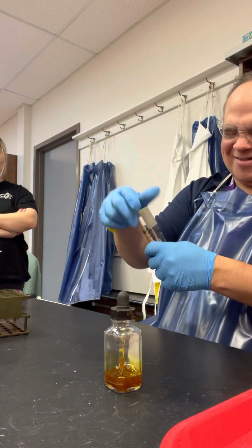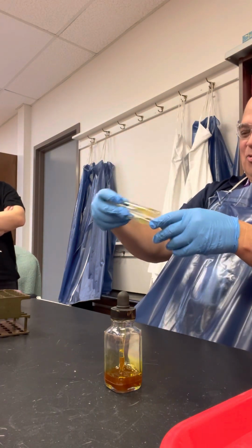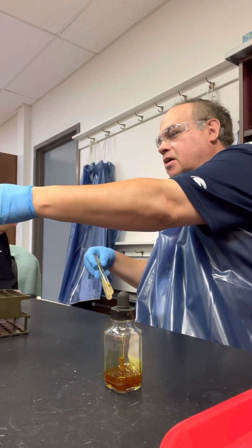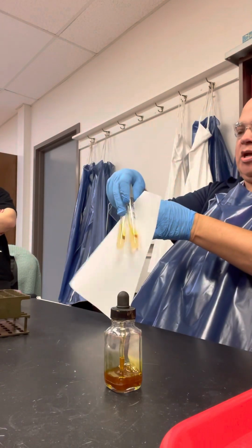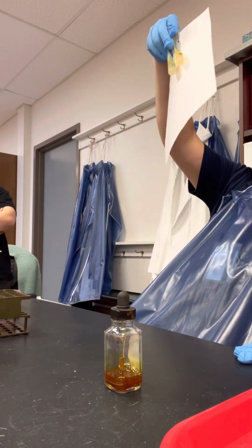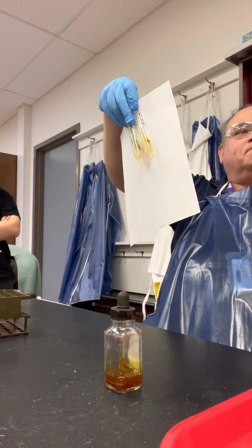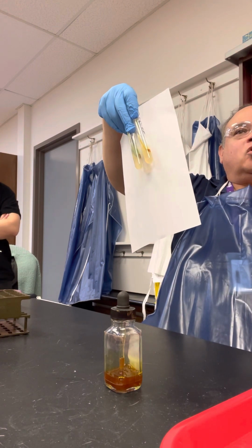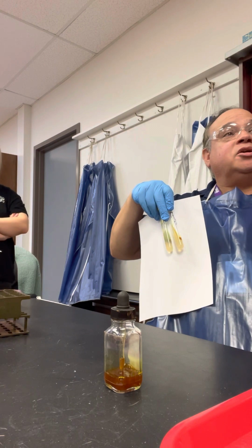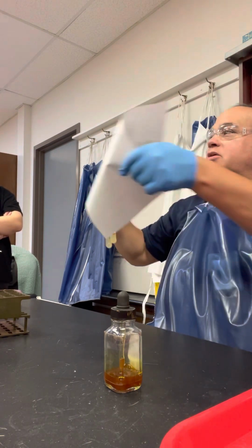When you mix these up, can you appreciate that one of them is green and one of them is not green? The one that is green is positive. The one that is not green is negative. Okay? Good? And it's positive for the enzyme, the utilization of phenylalanine. Okay? Good? Thank you, sir.